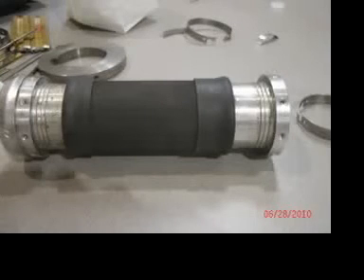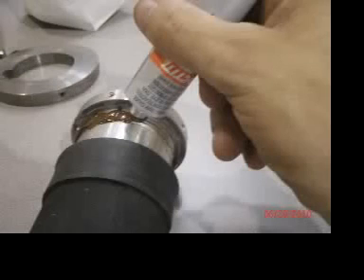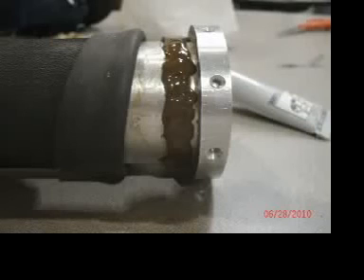Next, fold the ends back. Since the bladder is a little tight fit on the core, it's not going to move. Just simply peel the ends back, and that will expose the ends to put the sealer on it. A sealer called Permatex number 1 is what is used originally by JRC, and it seems to do a good job. It's easily available at almost any auto parts store across the country.